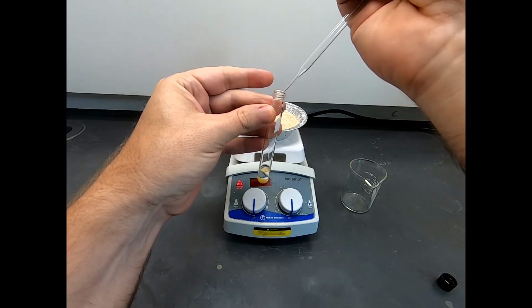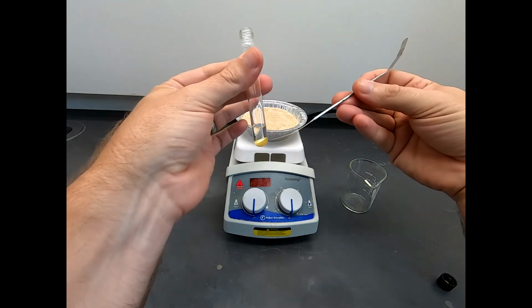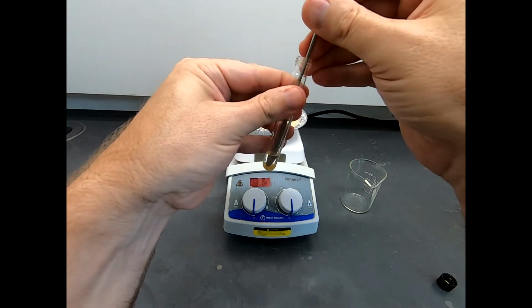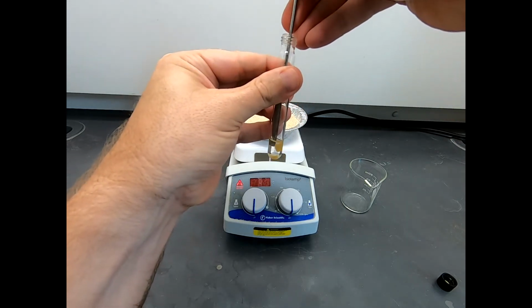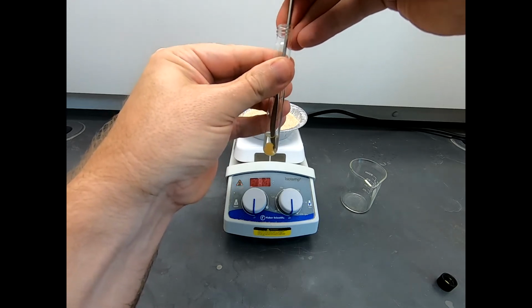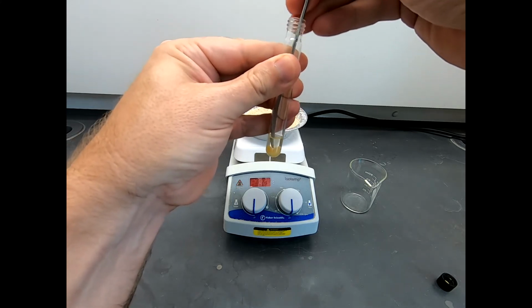Because all we're doing with this ethyl acetate is getting this product in solution, and then we're going to add a little bit of hexane to precipitate it back out. And in doing so, hopefully we're going to leave behind the impurities. So I'm going to kind of scrape on this a little bit, break it up. That'll increase the surface area, but it's going to take a little time for this to go into solution. These pieces are going to dissolve, they're going to get smaller and smaller, and eventually they'll be gone.